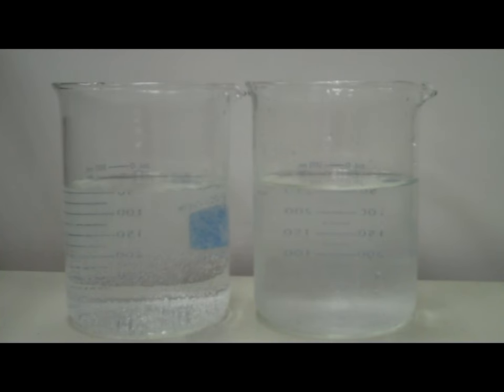So on the left, you have the hot water. On the right, you have the cold water.